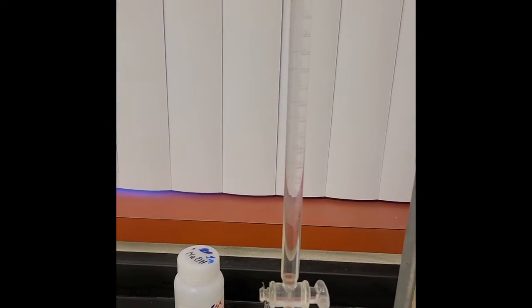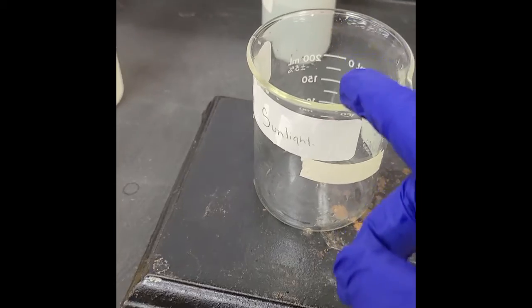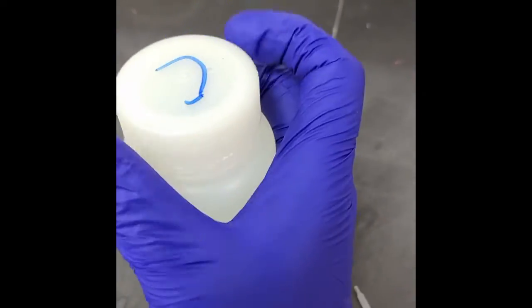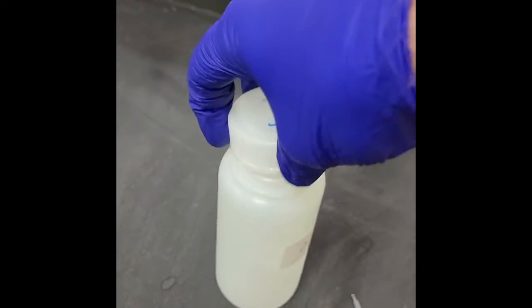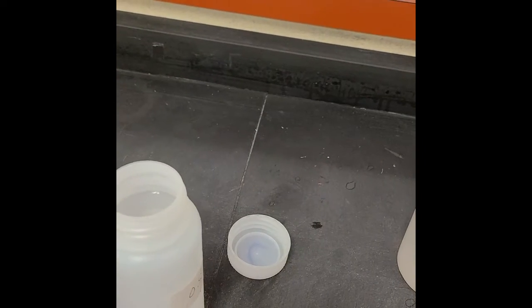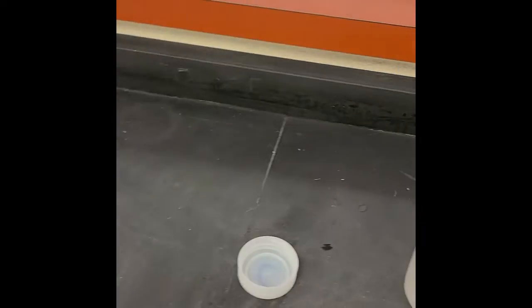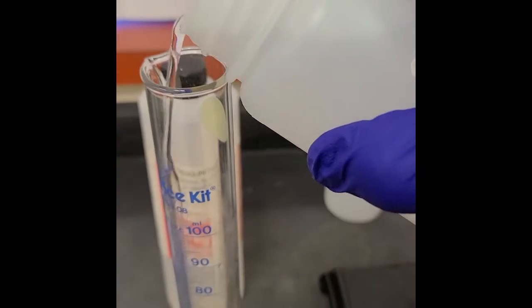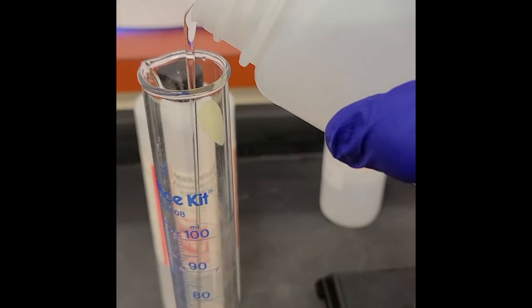We're going to use this to slowly drip down until we reach a point where the hydrochloric acid that's about to go into this beaker right this second turns neutral. And to make this go a little bit quicker, I'm only going to use about 25 milliliters. I'm confident that this is going to be less than 1, but we're going to slowly add.